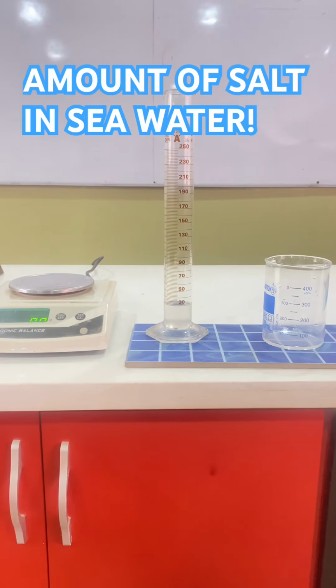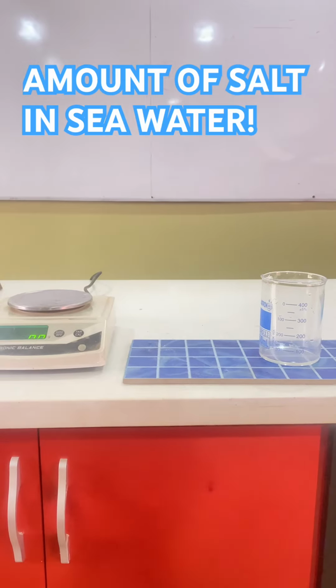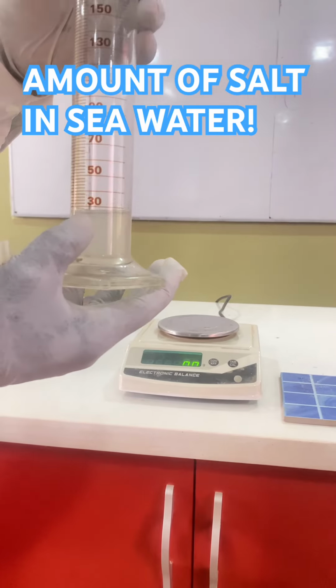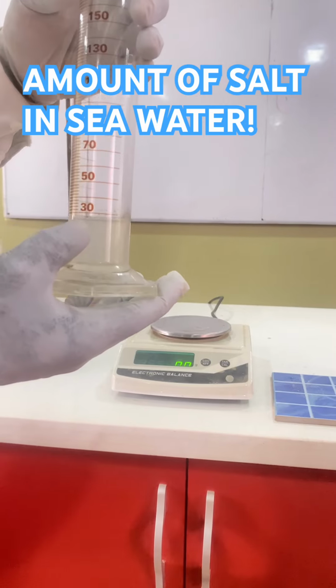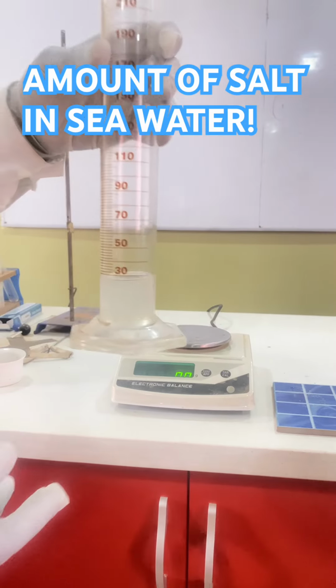Okay, today we are going to find out the amount of salt that is dissolved in a given solution or a given liquid. Today we have seawater. So we are going to heat this seawater in an evaporating dish to find out how much salt is dissolved in it.